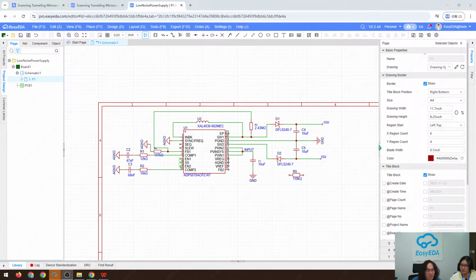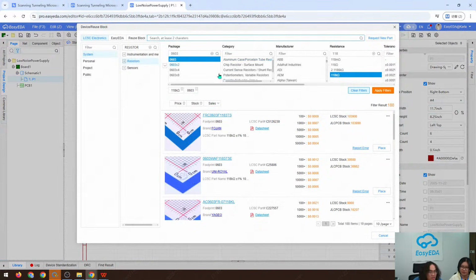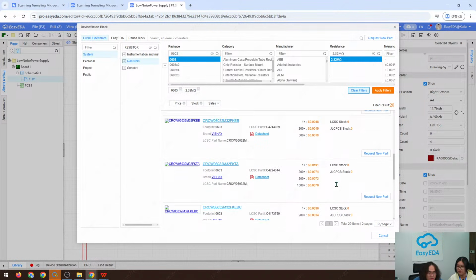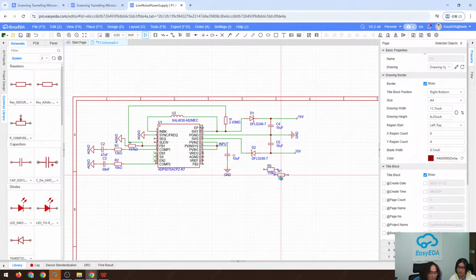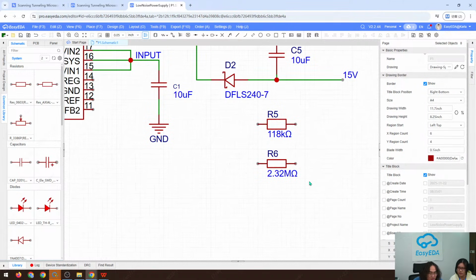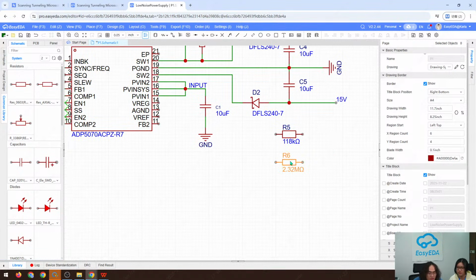So let's continue our schematic drawing. So let's go back to the schematic, and I can simply copy and paste. There might be no symbol available here, but I think we can choose from our common library and set the resistance. So when we buy this, since it does not contain the details of the manufacturer, we have to choose it manually.